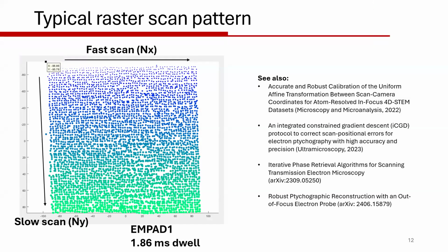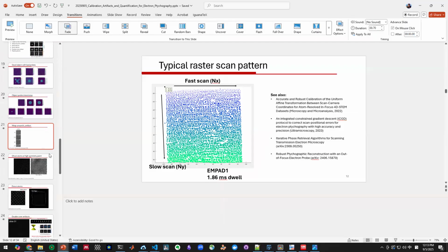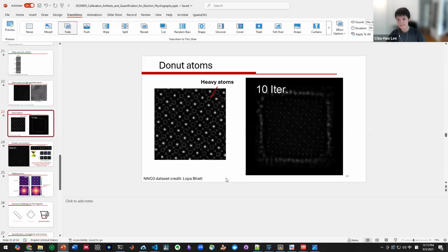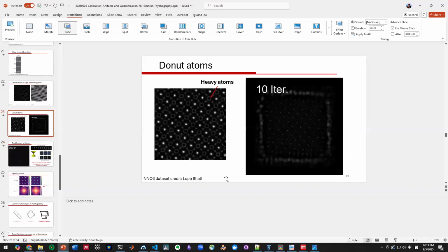Hey, Harry. Hi. Thanks for the talk, great as always. I had a quick question about your donuts versus the double cone. I understand the different origins of them physically, but when you're looking at them, especially in projection, I would imagine they look very similar. Like this dark in the middle, and then this light streak going out. How do you know when you're getting which?